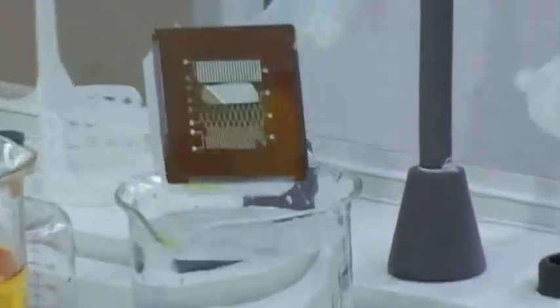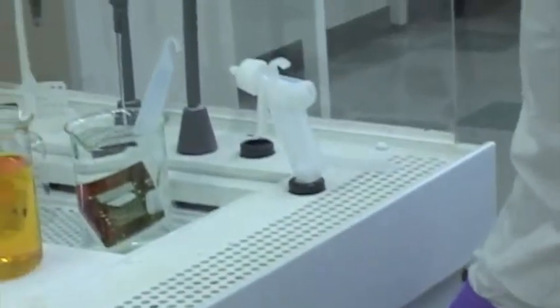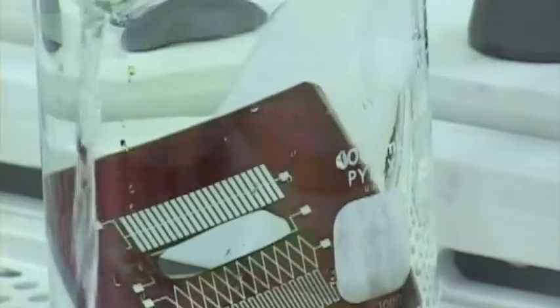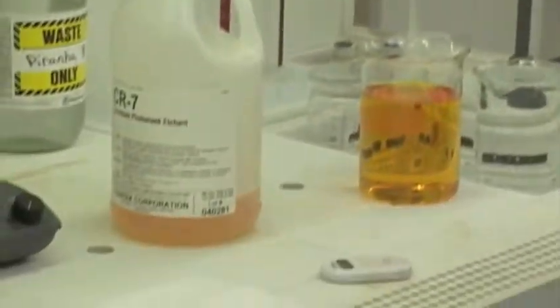Into the water. Now we're gonna do a cascade rinse. Alright, now that our mask has been rinsed off in the water, we dried it off, it's done.